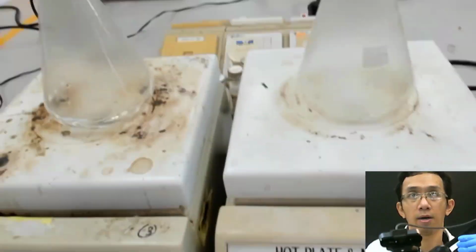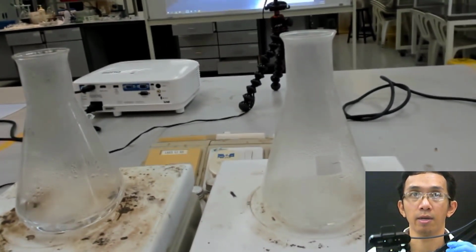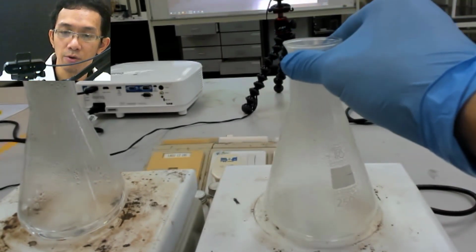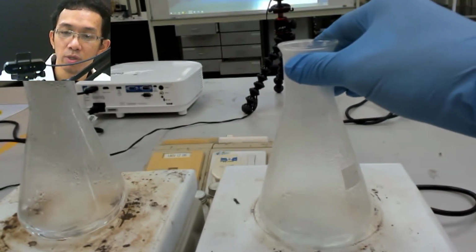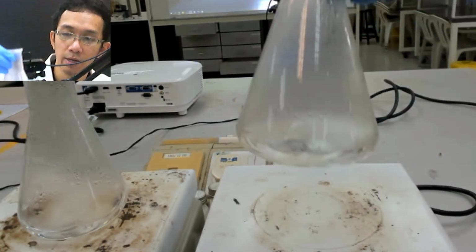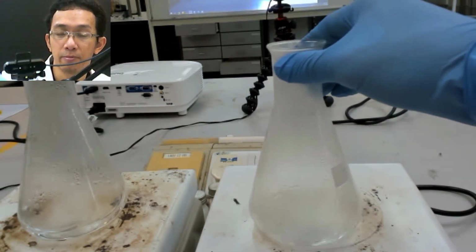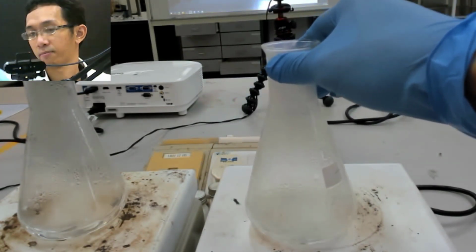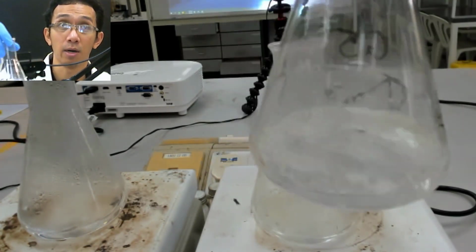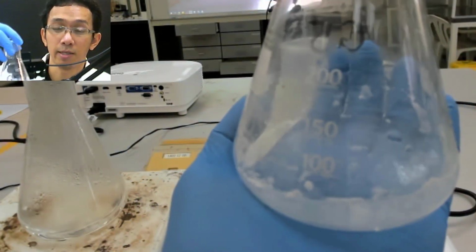So if you look here, let me bring myself up again. What you do now is try to swirl slowly and slowly. If you look here, there is no more salicylic acid there. Compare this with this. This is what we did just now without heating. There is some salicylic acid there. You see there is some salicylic acid without heating.